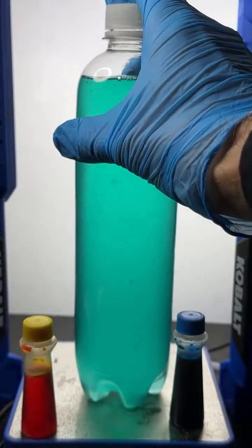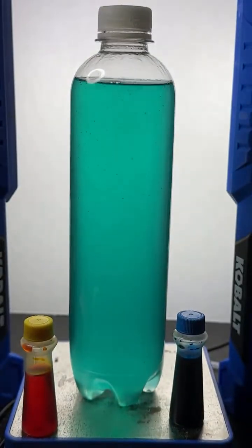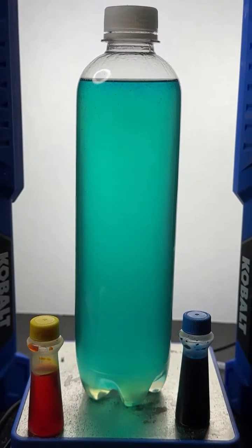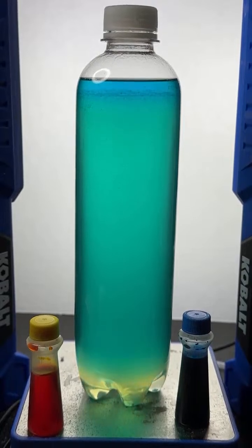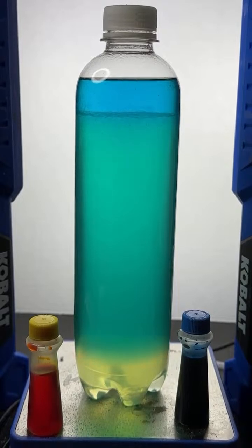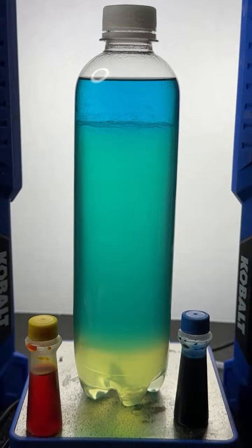Of course, when you shake it up, the blue and the yellow combine. See if it'll actually separate. Absolutely, Shrey. It's exactly how oil and water are separated. It's not just density, though. It also has to do with the way the ions in the salt and the molecules in the alcohol and the molecules in the water attract one another. It works like this.